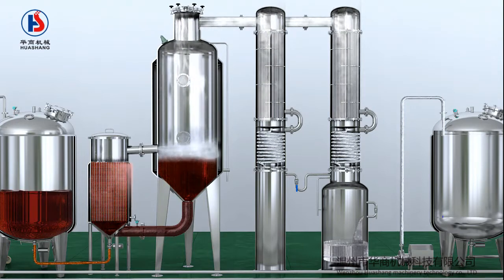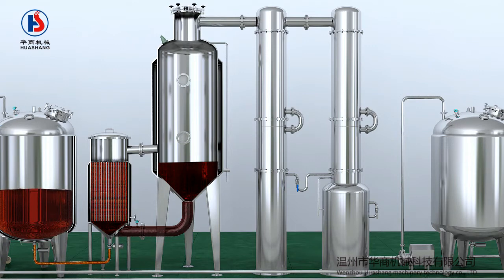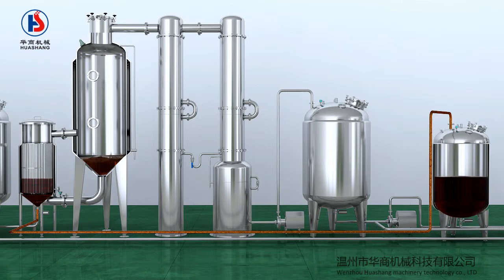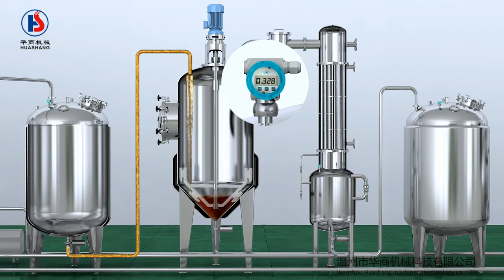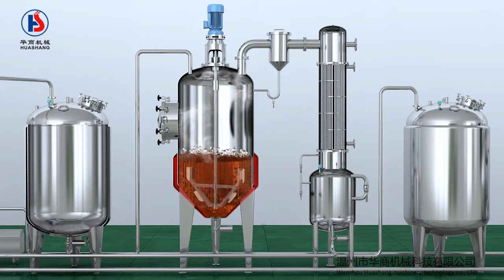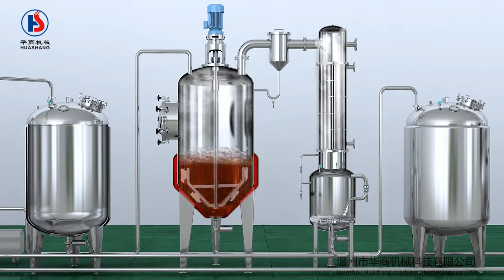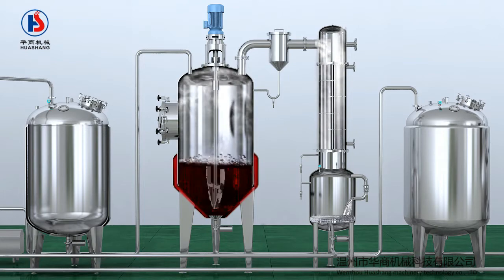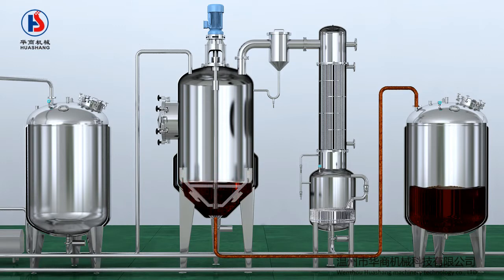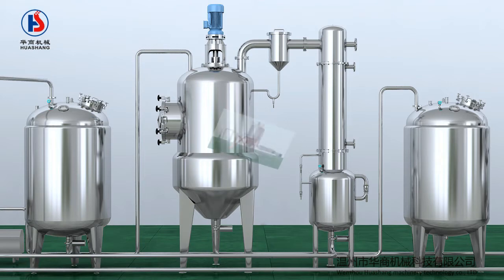When the concentration rate reaches the preset value, the system will stop heating automatically. Break the vacuum and open the bottom valve, and deliver materials to the concentrated liquid storage tank. If clients need a thicker material, the material can be transferred from the concentrated liquid storage tank to the vacuum decompression concentrator. Open the mixing and jacket heating system. The material slowly boils under vacuum condition. The generated steam will cool down by the condenser and flow back to the liquid tank. The concentration of the liquid in the vacuum decompression concentrator slowly thickens, and when the concentration reaches the preset value, the system will stop heating automatically. Break the vacuum and open the bottom valve, and the liquid will be transferred to the concentrated liquid storage tank.